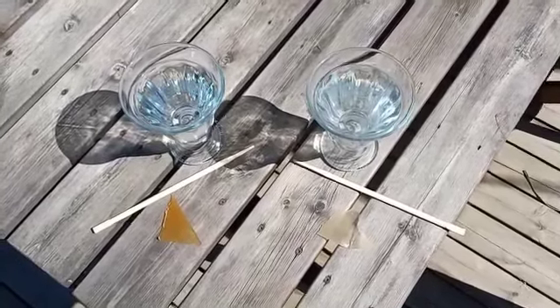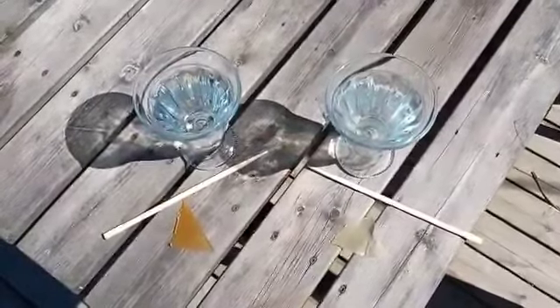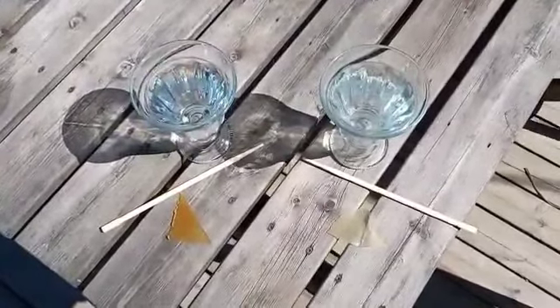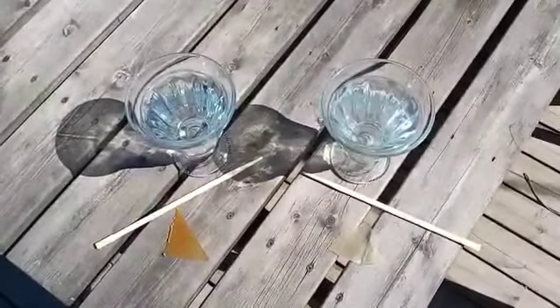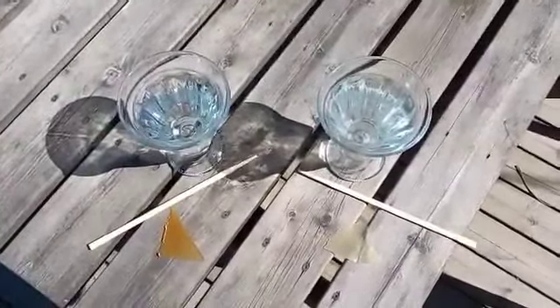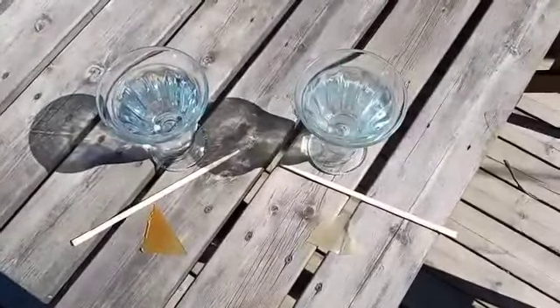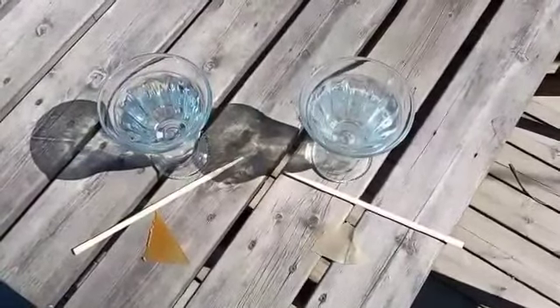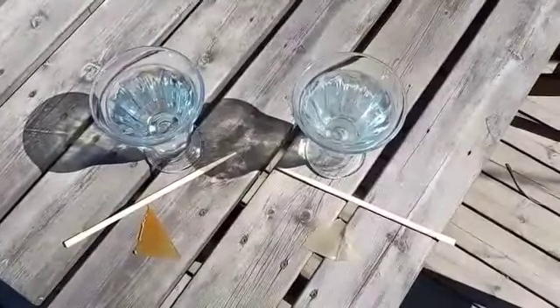This is Markus Finnilä, 23rd of May 2022. We are performing a water solubility test. The dark sample on the left side is Competitor, made in Europe. The sample on the right side is Dural GmbH.